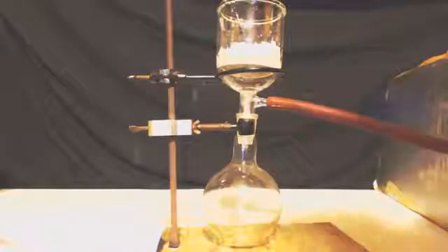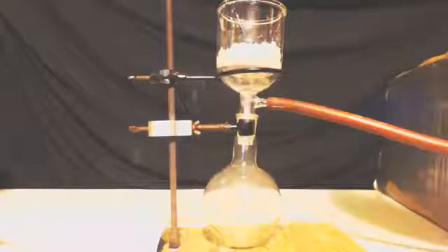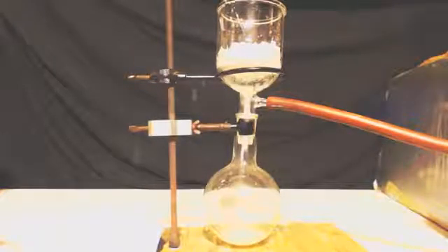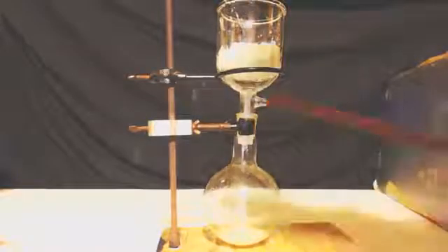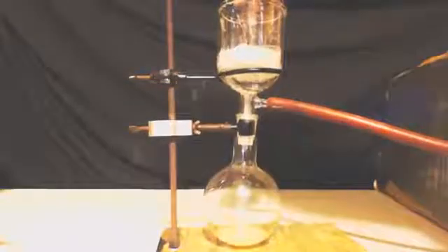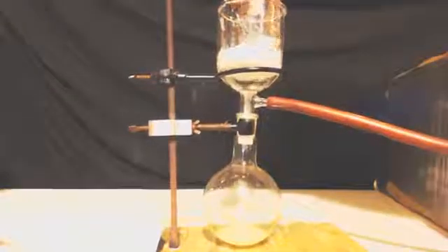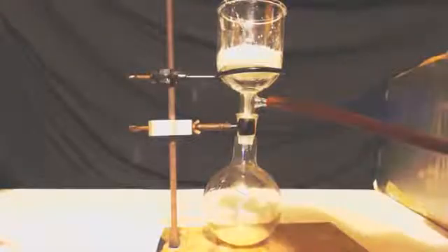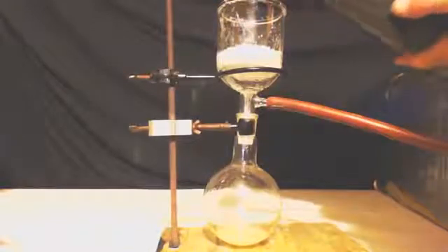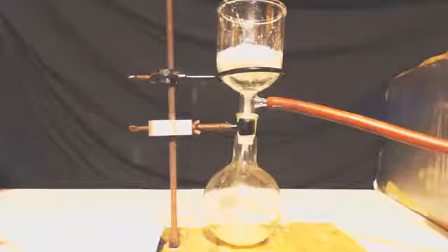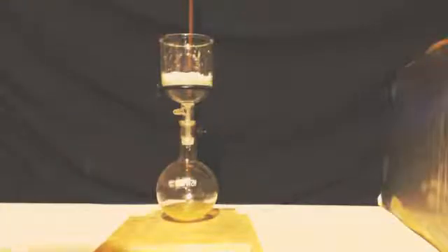All right, I let this sit on the radiator until it mostly evaporated. There is actually a little bit of water still in there. It's like slush. As you can see, I got the crystals in the fritted glass funnel. Turn on my vacuum. Push down on it. Wash it with ice cold water. Well, that bottom container, I'm going to recrystallize that and mark it almost pure. And that's all pure silver nitrate.